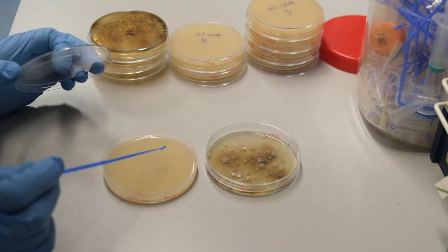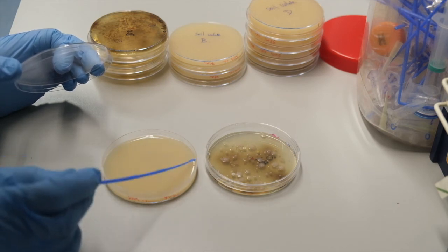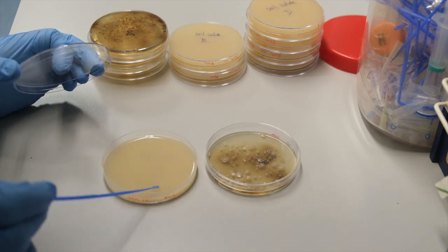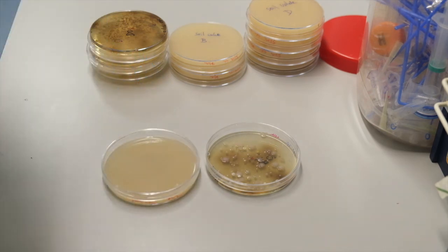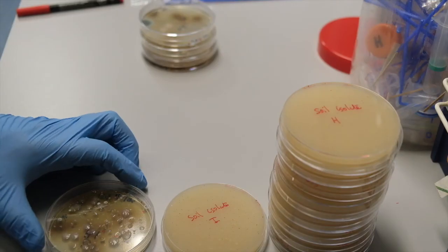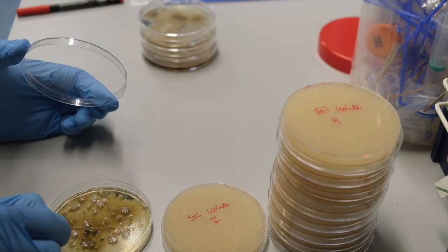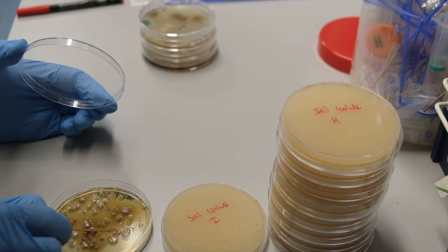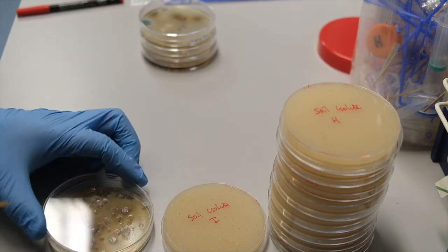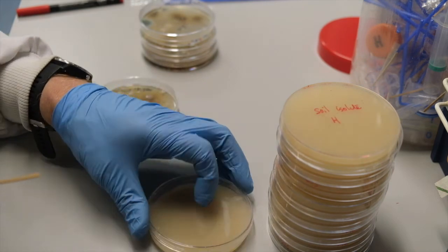The other chosen streptomyces soil colonies are streaked to single colony in a similar way. For the final colony, I have run out of plastic loops and so I'm using sterile toothpicks to streak out a single colony on soya flour mannitol. The technique is much the same.